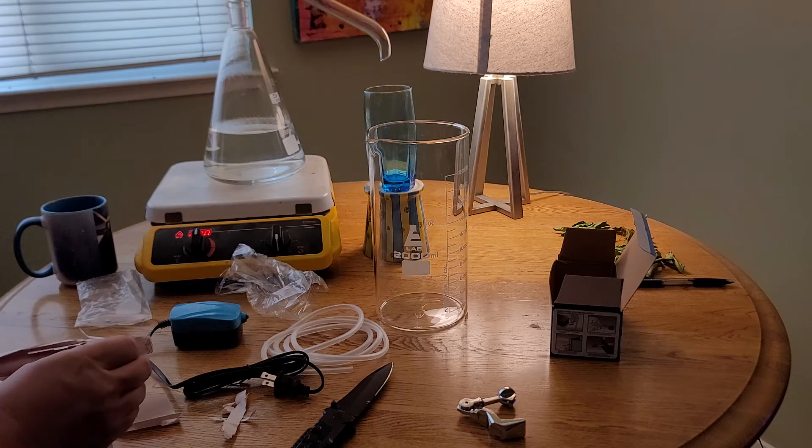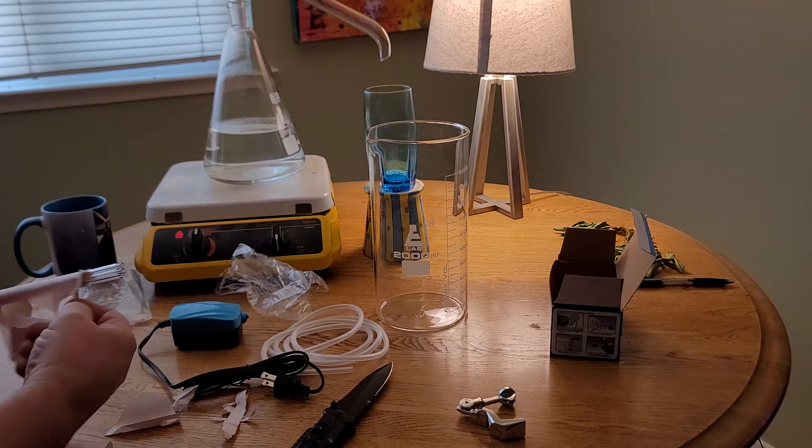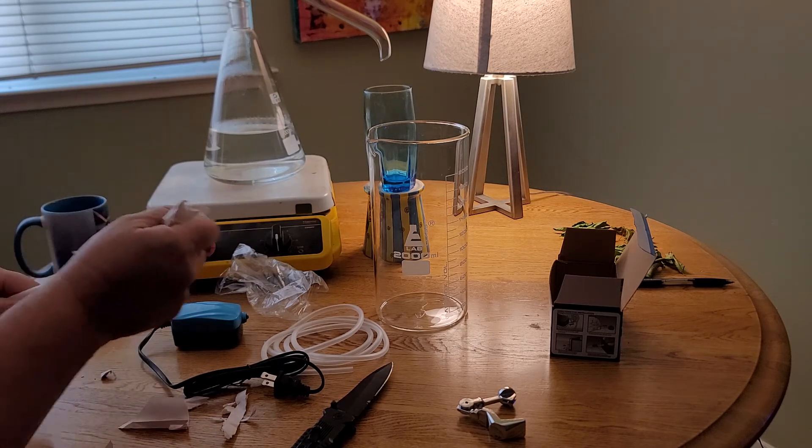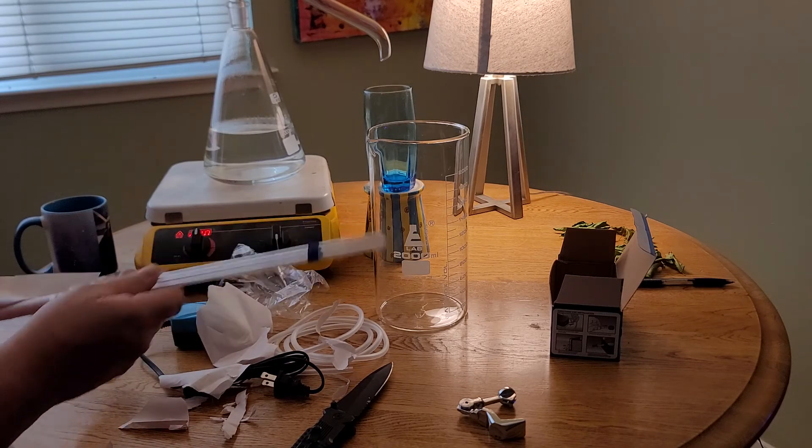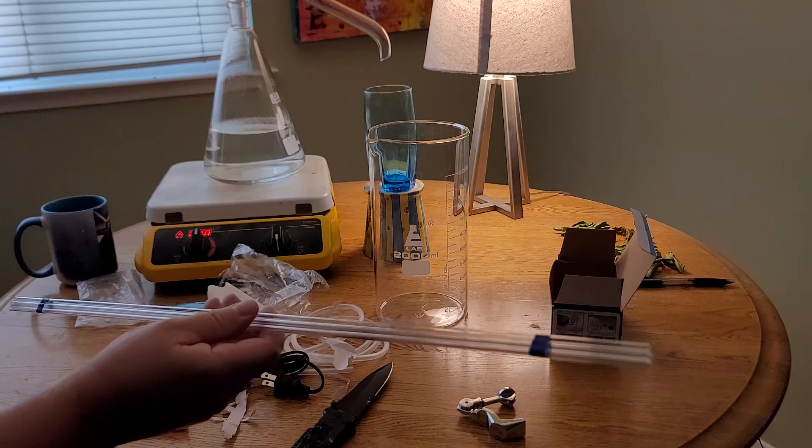I have some water distilling there on my hot plate in my Alchemist Alembic. Okay, here comes the glass tubes.